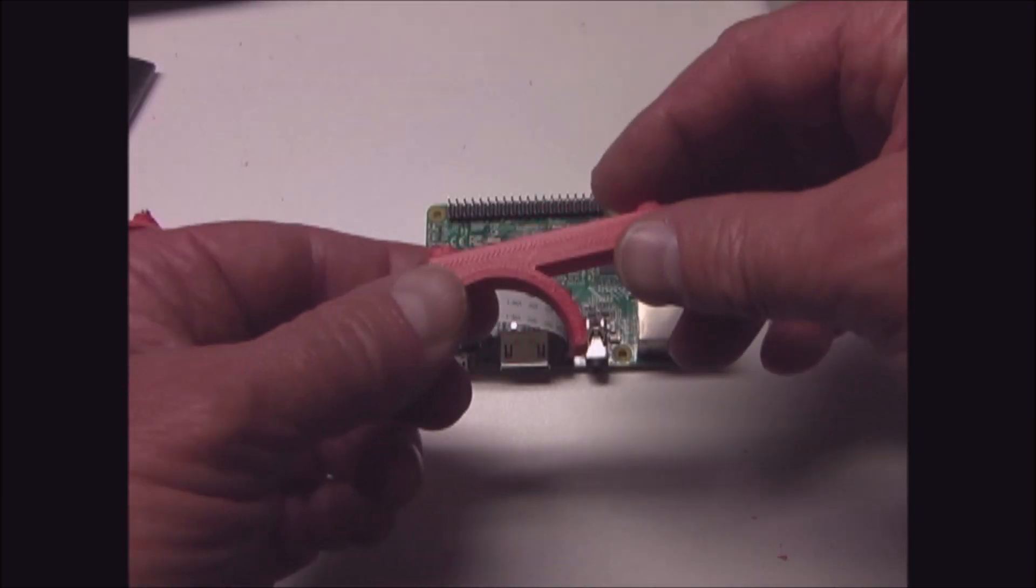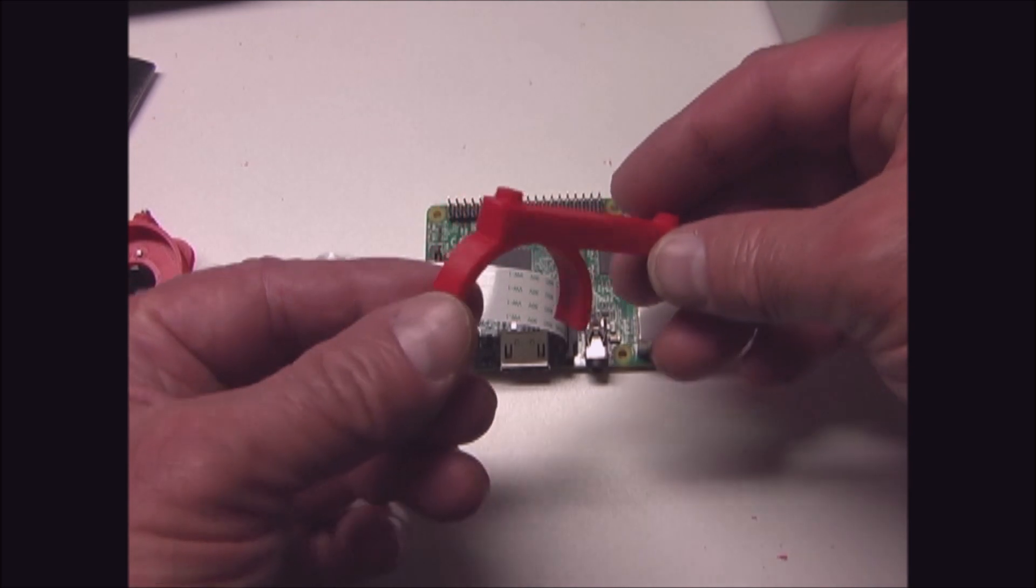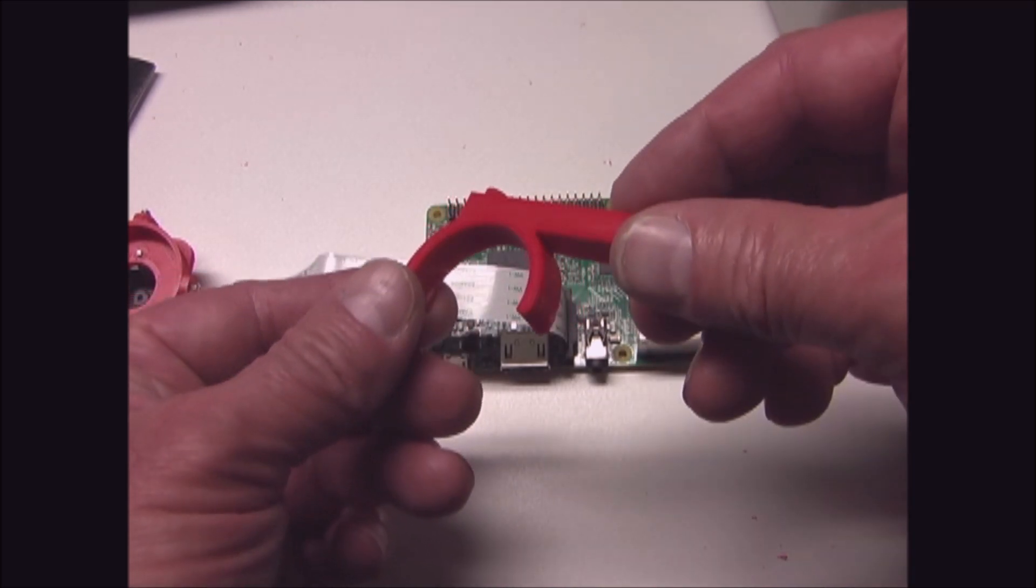The Raspberry Pi will be attached to the microscope with this 3D printed bracket that snaps on.